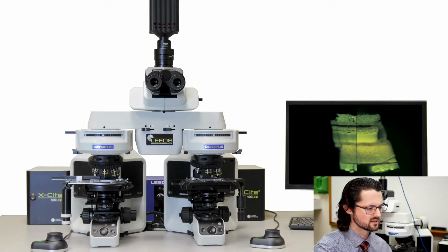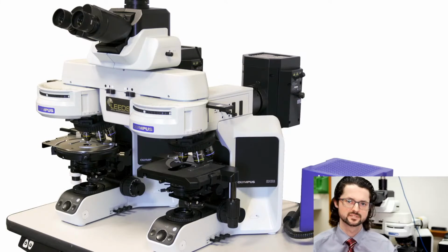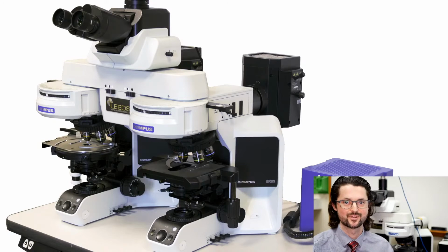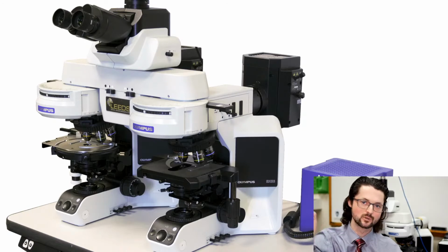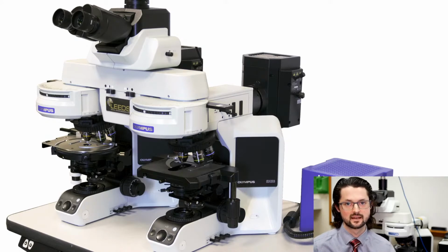There's kind of an intermediate step between these two light sources for reflected light for fluorescence. It's something called a metal halide. Essentially it's an advanced version of a mercury burner, or a mercury light source is the best way to put it. Instead of having the lamp house directly attached to the reflector, what it has is a long liquid light guide. So think of fiber optic cable, but it's filled with oil. And then that goes down to your light source itself.